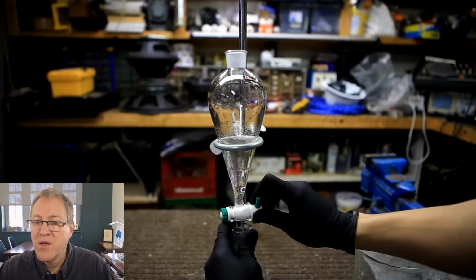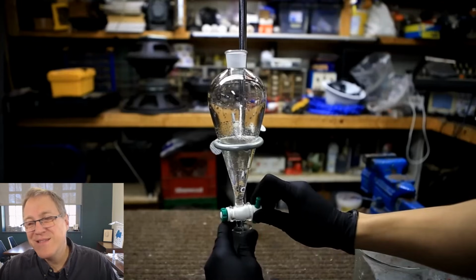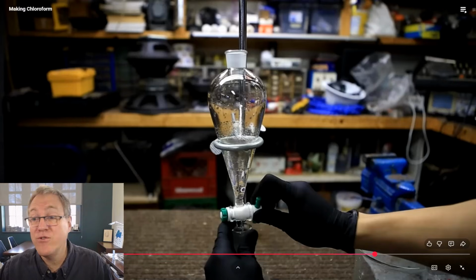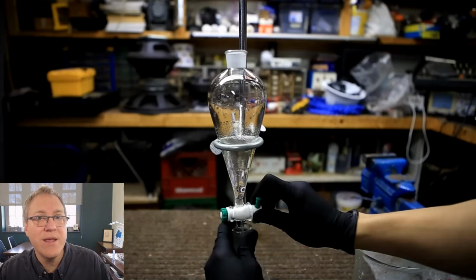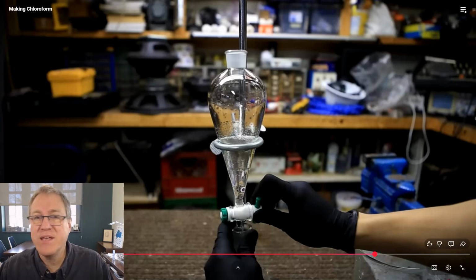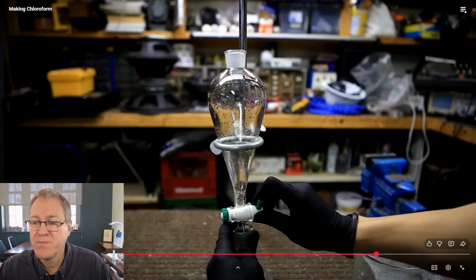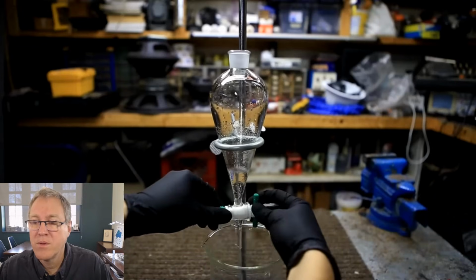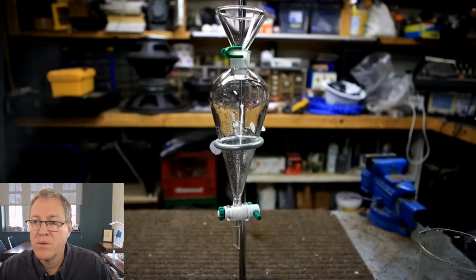Allow the two phases to separate. So you can see there, well, it's hard to see in a static image, but there is a bottom layer, that is his chloroform layer, that's his desired product, and that top aqueous layer he's really not interested in. So he's using a separatory funnel, which is a great way to separate immiscible liquids to get his product out. Drain the lower chloroform layer. Add the upper aqueous layer to your waste container.